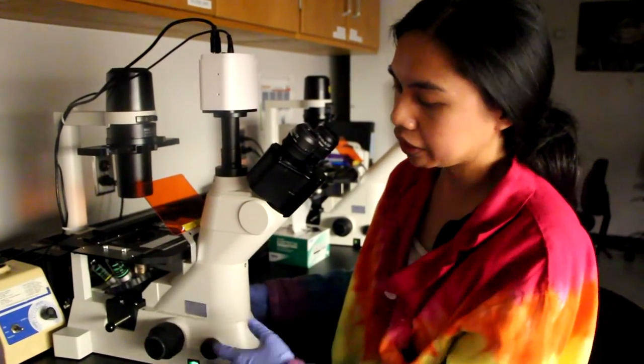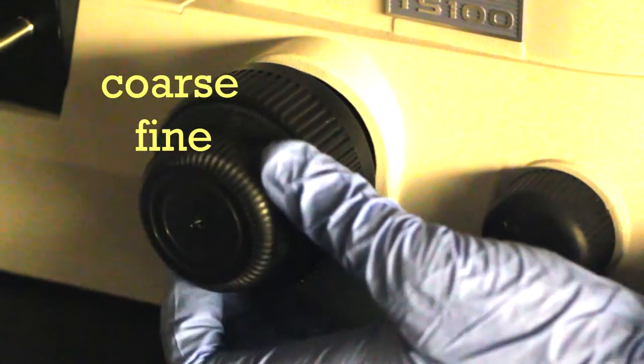In order to focus our samples, we're going to use this knob right here. It's actually two knobs where the larger one focuses coarse adjustment, while the smaller one focuses the fine adjustment.